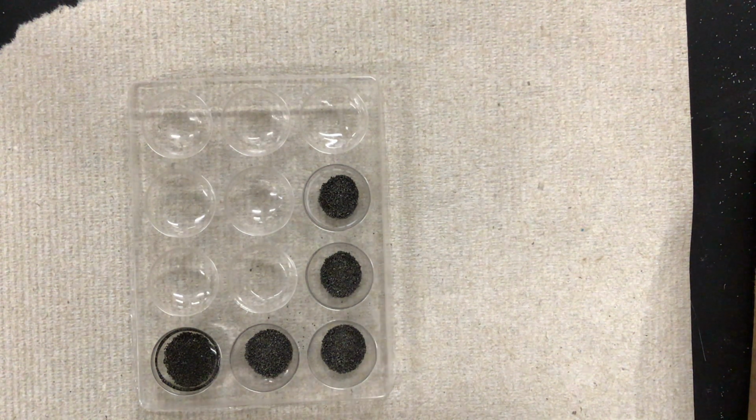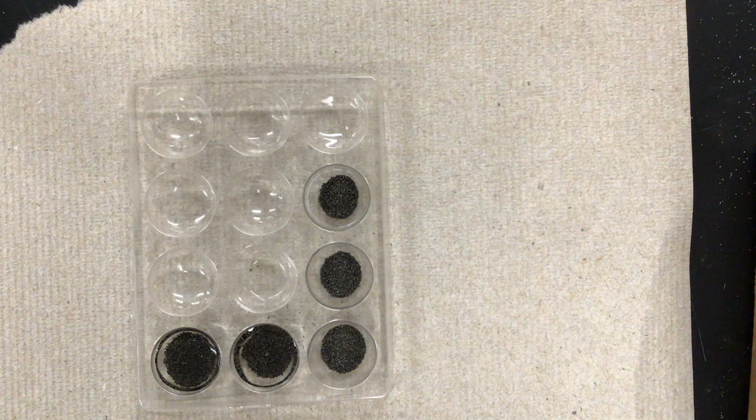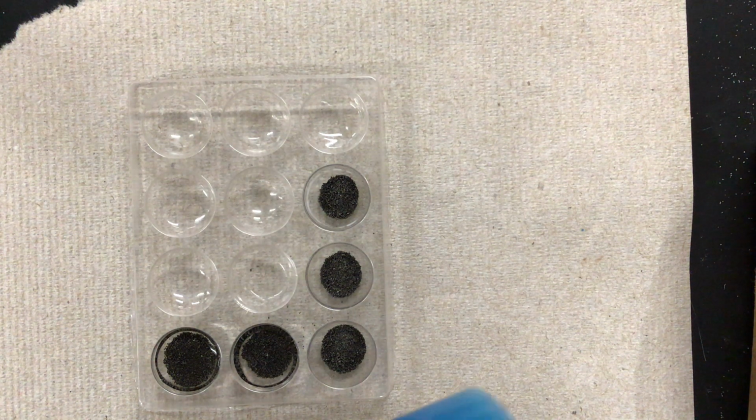Next, we're going to react lead nitrate. It doesn't look like anything's happening with these first 2 reactions, so you can say no reaction for either one of those. You can just put an NR for no reaction because it doesn't look like anything's going to happen with those. The next one is copper sulfate.